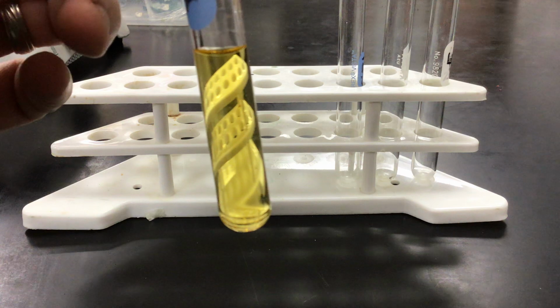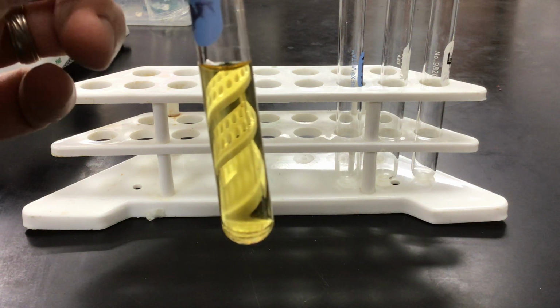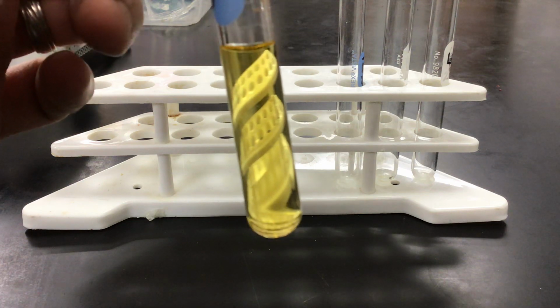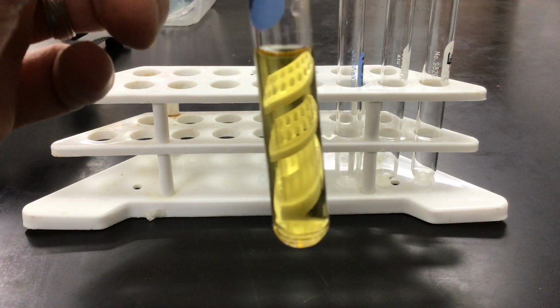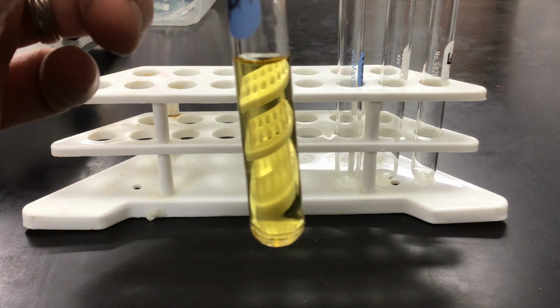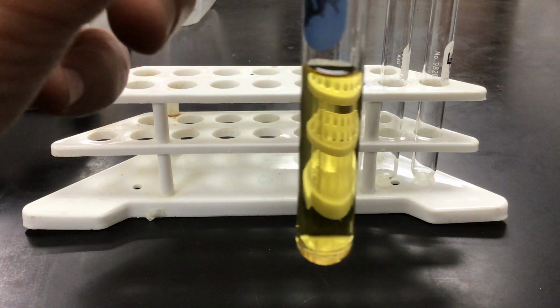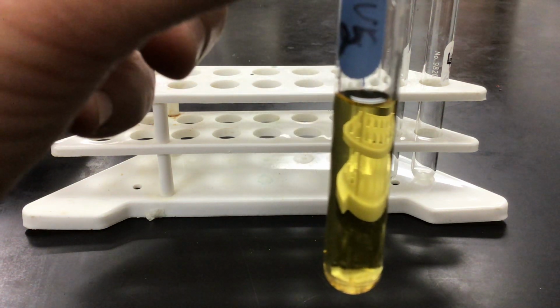Okay? That's stress 1. So now put the observation down in the data table and fill in the additional information. Now I'm going to come back and do stress 2 of the system. There's 2 parts to this problem. Now I'm going to add sodium hydroxide. Sodium hydroxide is a base. We just got done adding an acid, so now we're going to add a base. I'm going to add 5 drops.